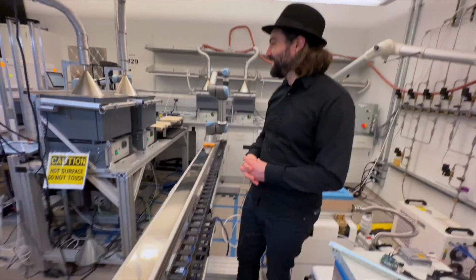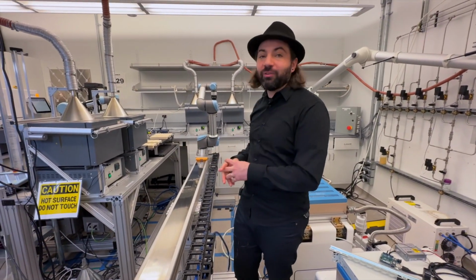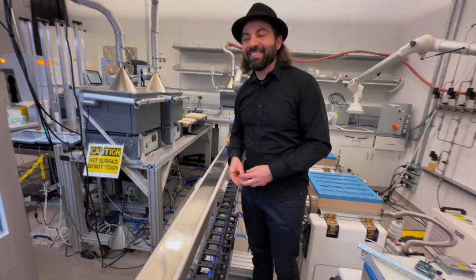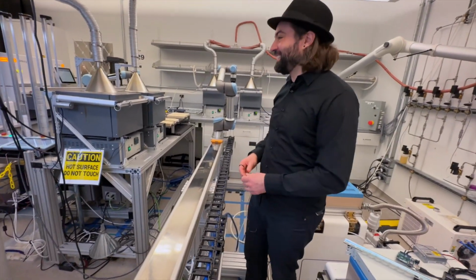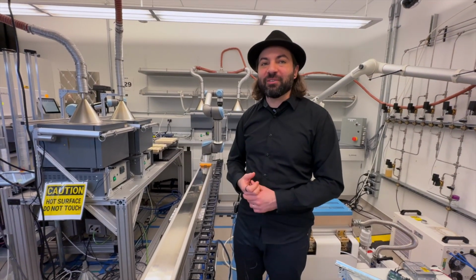That's amazing. And the question about 4 furnaces, right? It's because we can only have 4. If we had more space, we'd have more than 4. That's for sure. There we go. So, donors, I hope you're listening. Open up those checkbooks. Let's create a larger space here and have more than 4. Amazing. We want to expand the lab as much as possible.